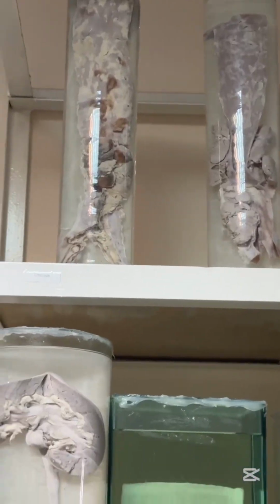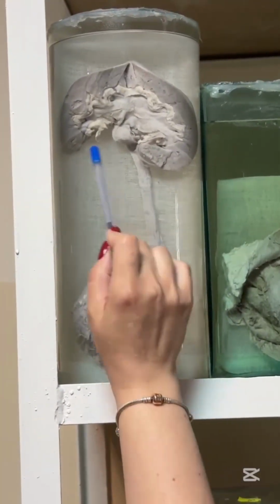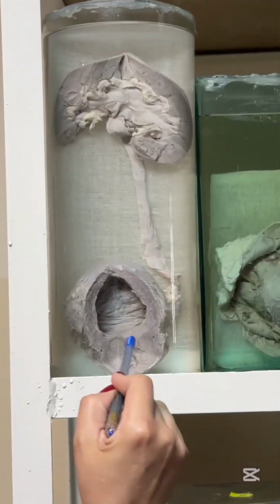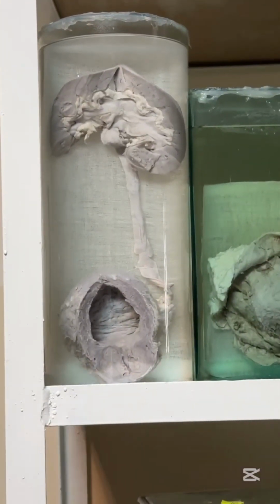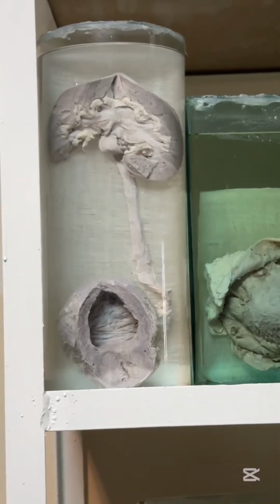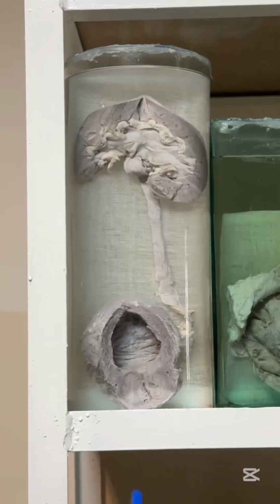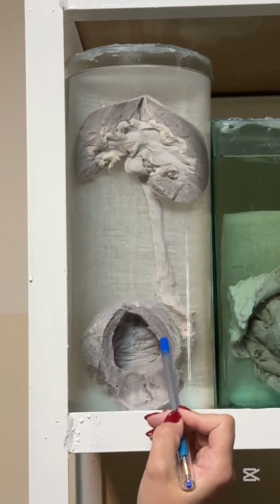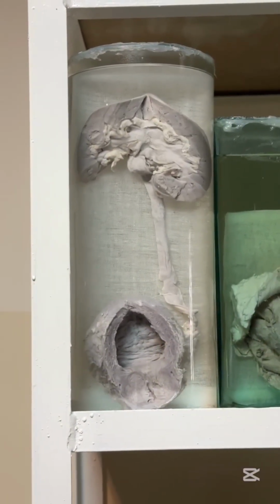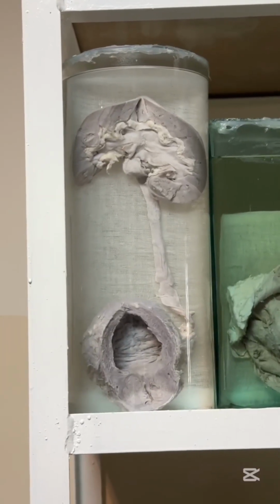Okay, this one, that is bladder, ureter, and kidney. Here you can see prostate. Prostate is enlarged due to hyperplasia or adenoma of prostate. That's why something like obstruction of urinary tract. That's why you see hypertrophy of wall of urinary bladder. It is wall hypertrophy because of overworking.